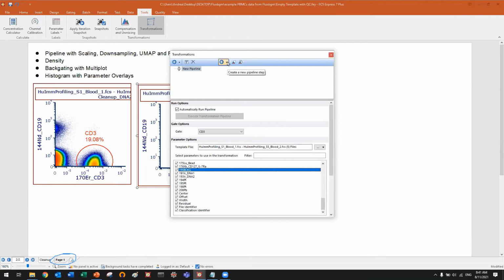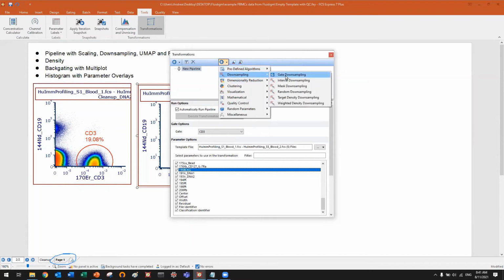So from this plus menu, you see I can access all the steps. You see we have predefined algorithms. Those are mini pipelines, I would say. We have FlowAI, FlowCut, FlowSOM, SPADE. Then we have single steps, downsampling. You can add a gate downsampling if you want to narrow down. Now we are starting with the CD3. Maybe at some point in the pipeline, at step number 27, you want to narrow down your calculation to a subset of CD3, you can do that. Then we have interval downsampling, random sampling. We have a lot. We have target density downsampling. This is the density downsampling invented by SPADE years ago. Then we have dimensionality reduction: PCA, t-SNE, optimized t-SNE, UMAP. Clustering, and a lot more.